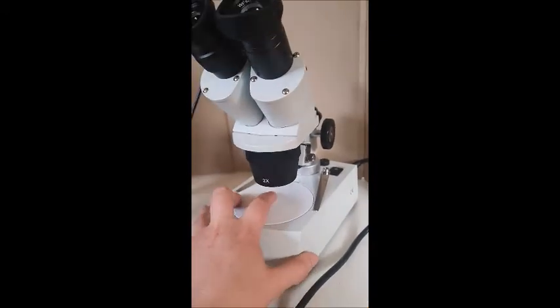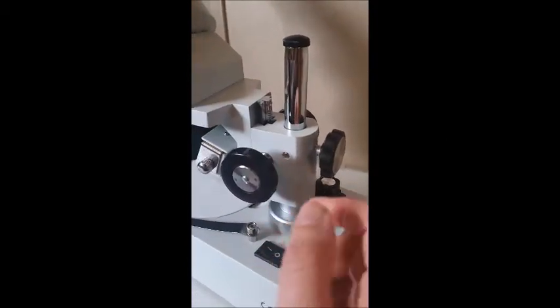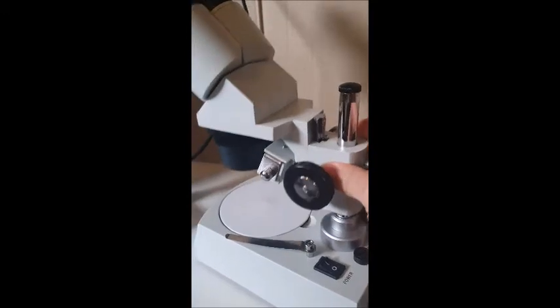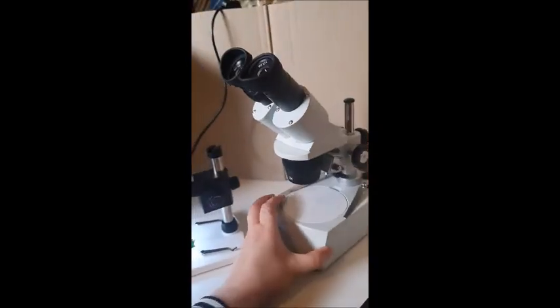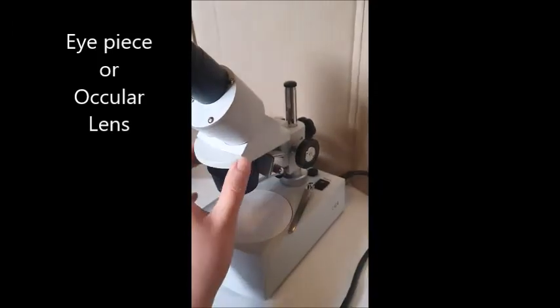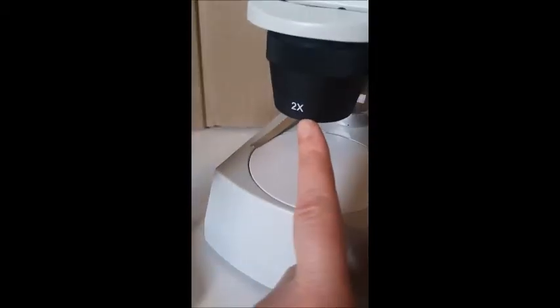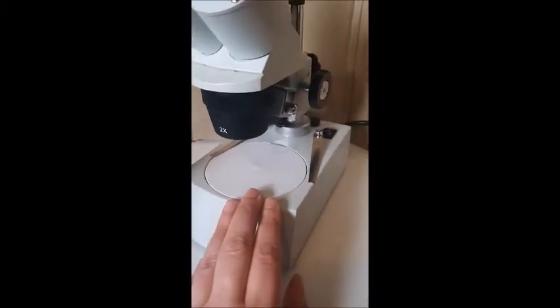It doesn't have a stage for a slide, but it has this base. And it only has a coarse focus that moves it up and down. But it also has this. So you can loosen this and lift the entire thing up and down. We have the eyepiece, which is 10 times. Then we have the nose piece, which holds the objective lens. Here's the objective lens, 2 times. Eyepiece is 10 times. So what does that make the total magnification of this one?